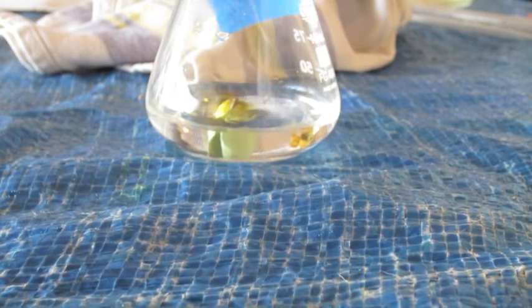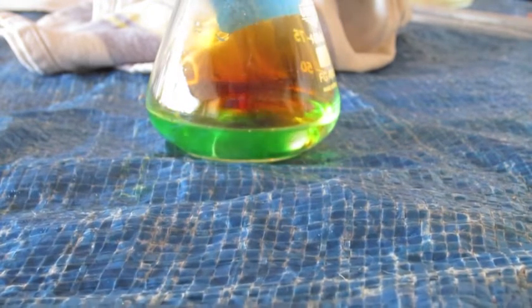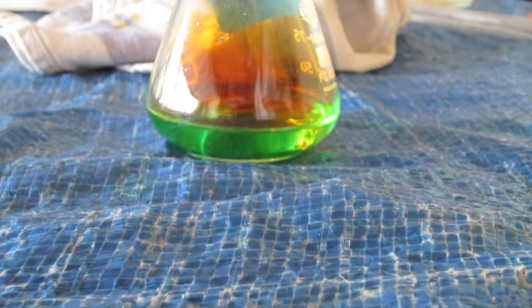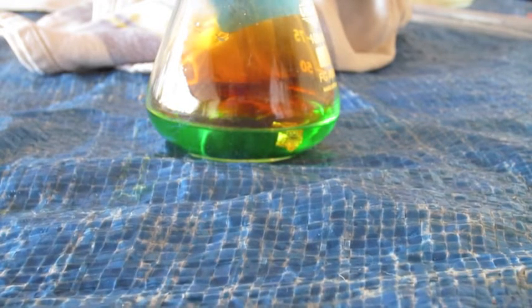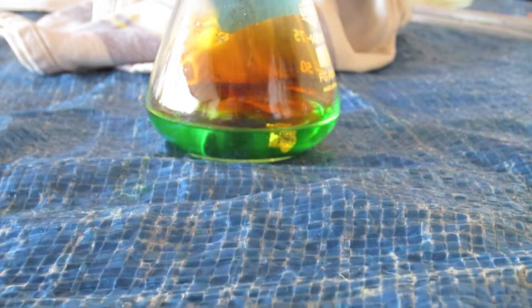Copper withstood hydrochloric acid, so now I'm putting it in nitric acid, which is an even more corrosive acid, and as you can see, it succumbs to the nitric acid. It is reacting, and it is forming copper nitrate and nitrogen dioxide gas. It's quite a cool reaction, and the end solution is a blue-green.